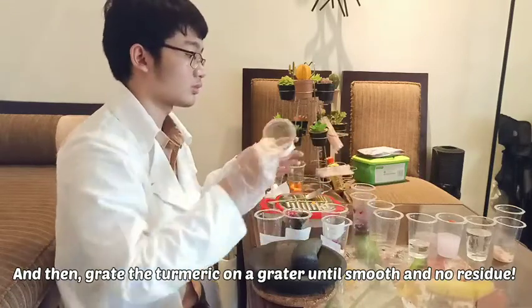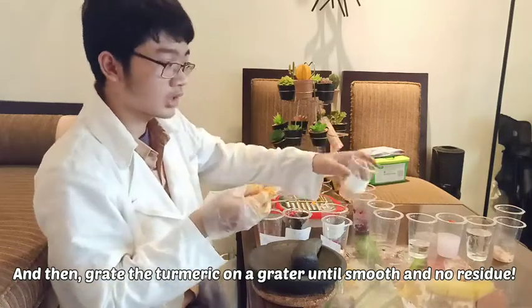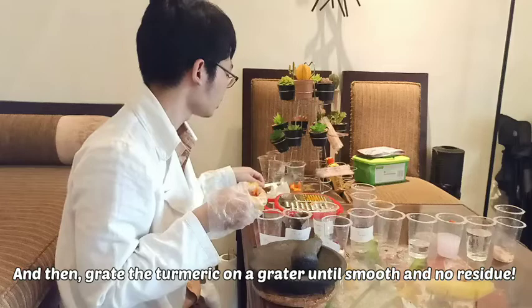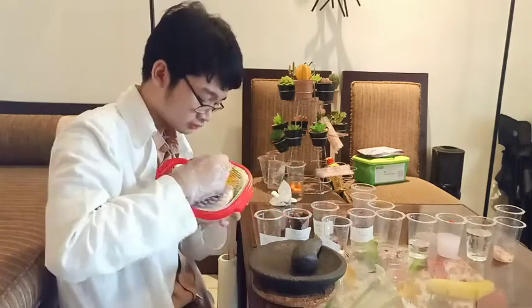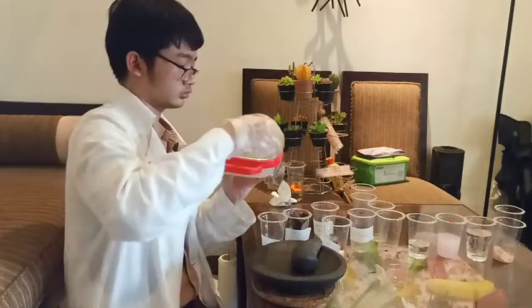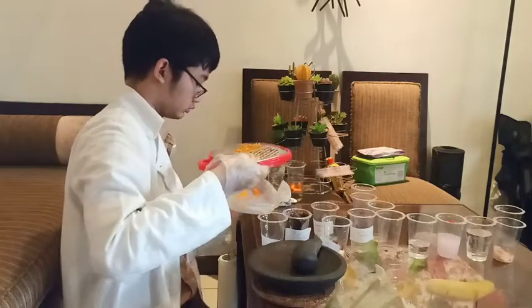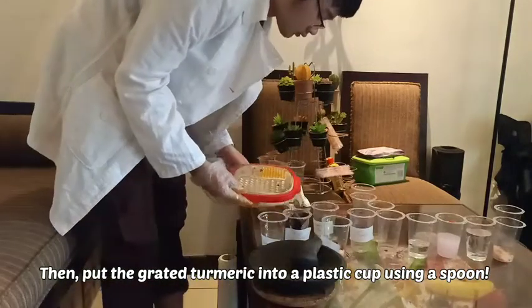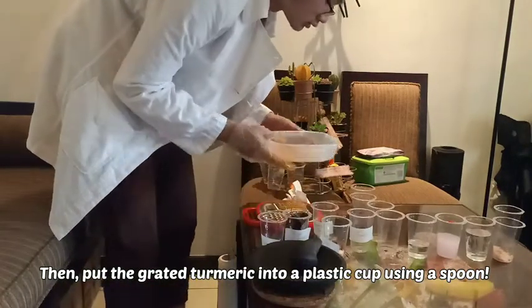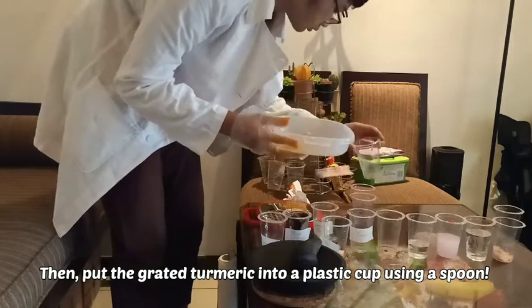And then grate the turmeric on a grater until smooth and no residue. Then put the grated turmeric into a plastic cup using a spoon.